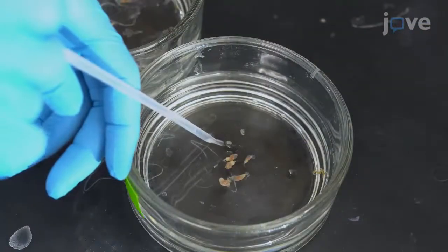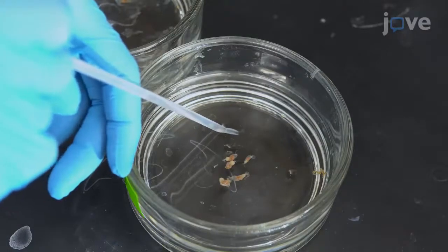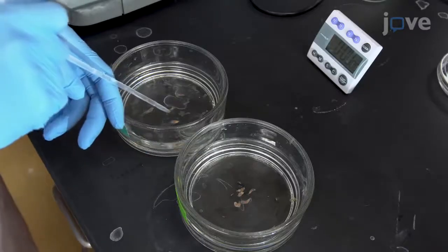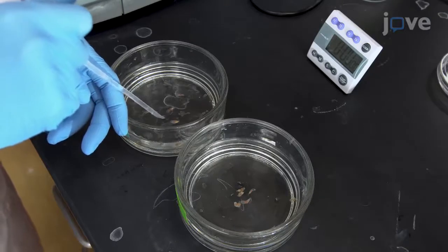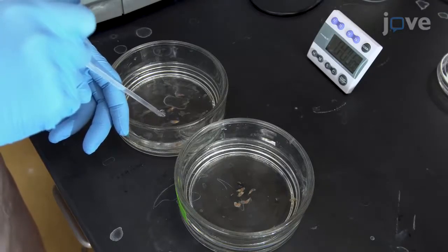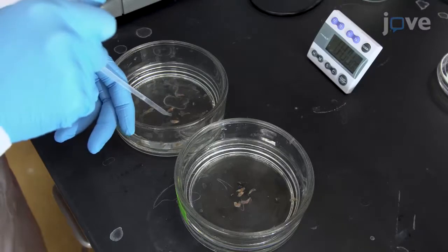Use a transfer pipette whose tip is cut to enlarge the opening to place egg packages from the female container into a sperm-containing male container and leave them in the male container for at least 15 minutes to allow for fertilization.